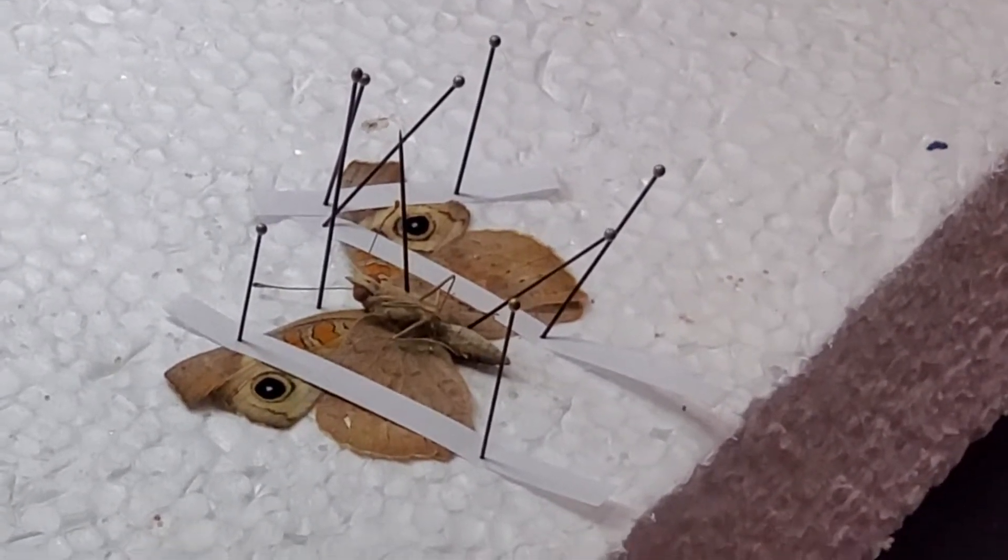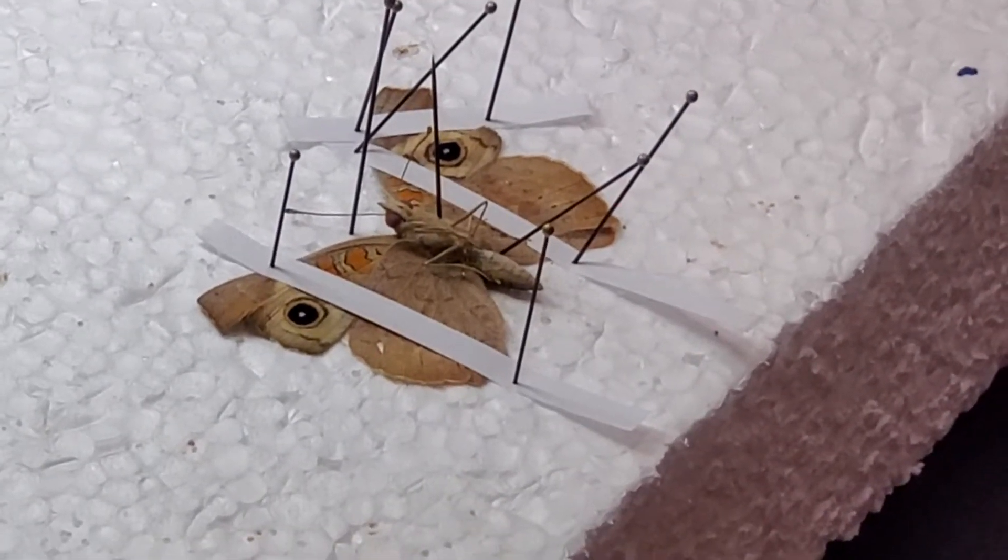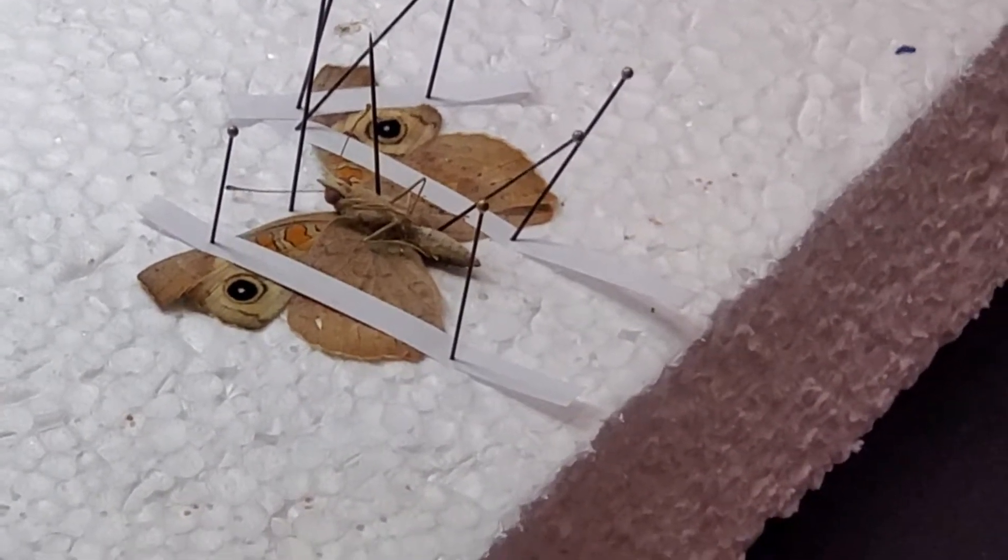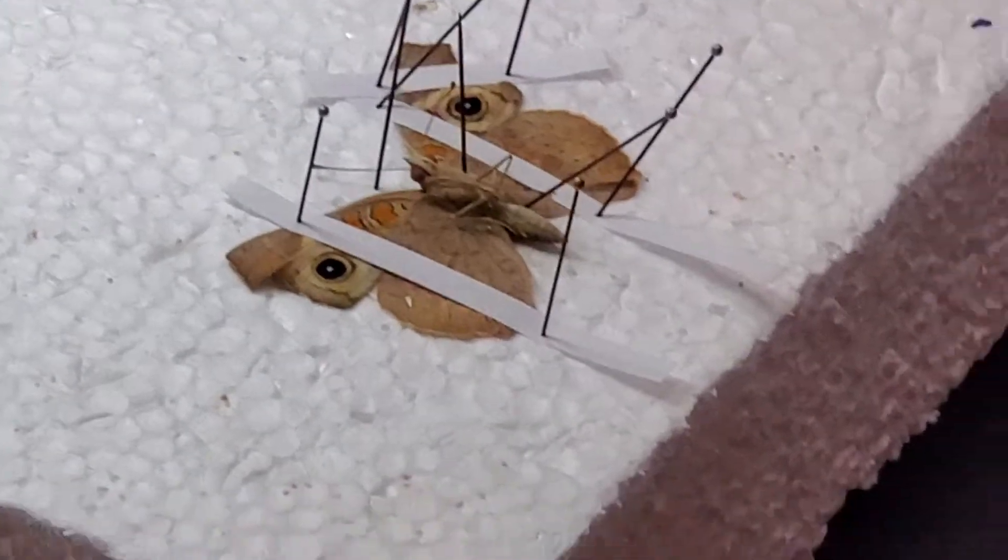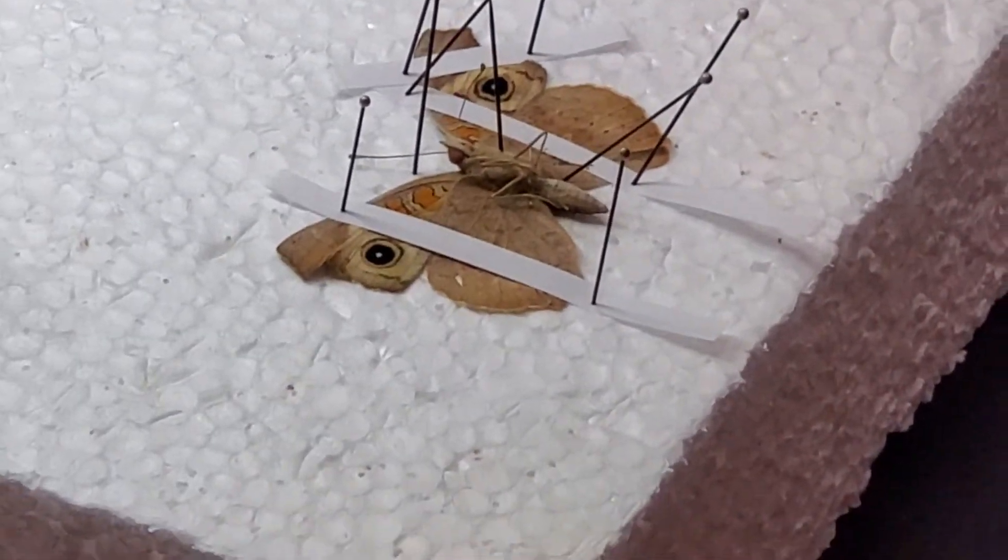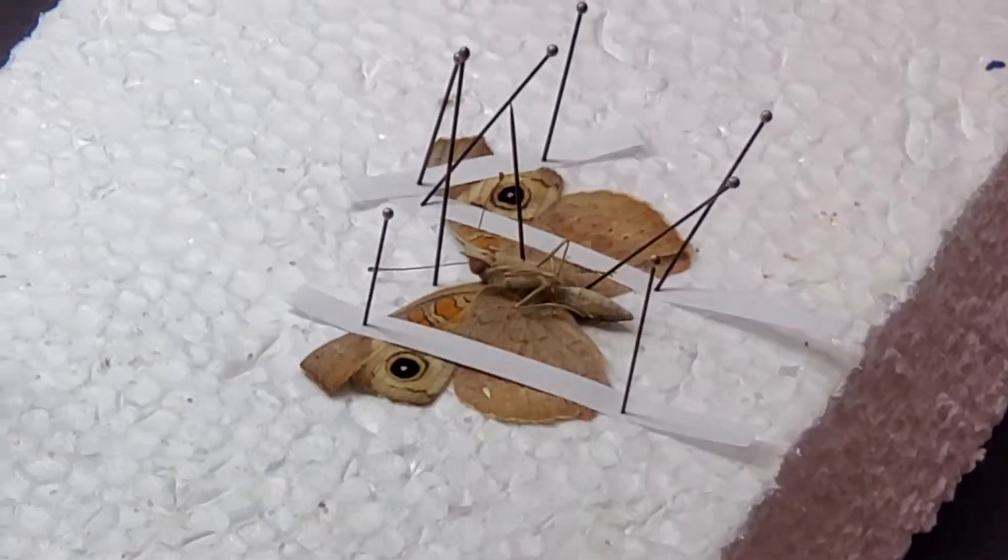A lot of students, for some reason, try to finish the whole job in three or four pins. It's almost impossible. If you're using 20 or 30 pins per specimen, I consider that's more or less average.